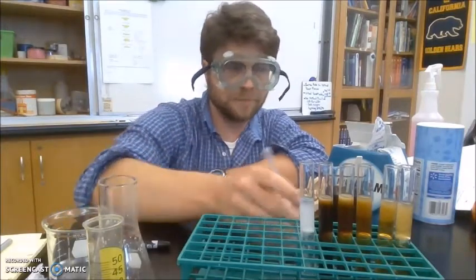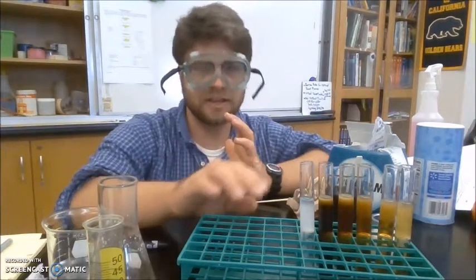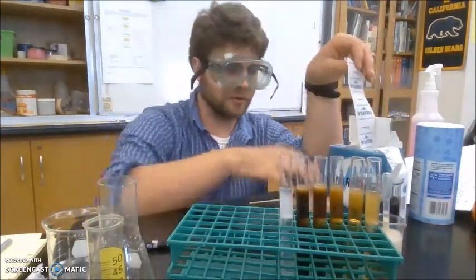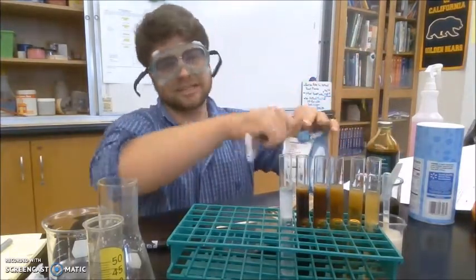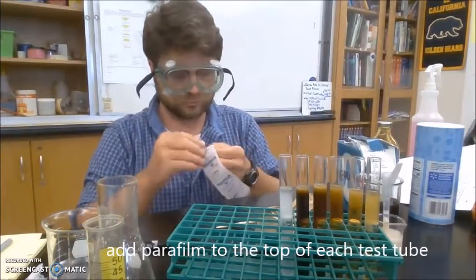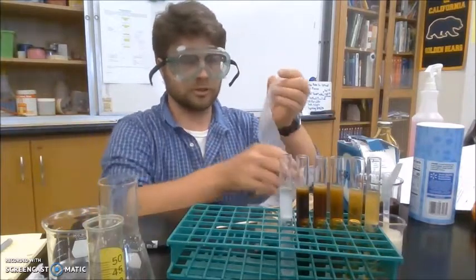All right, so I've added the yeast. And the final step, I want to add some parafilm. And so parafilm is going to seal the test tube. Pull it off.